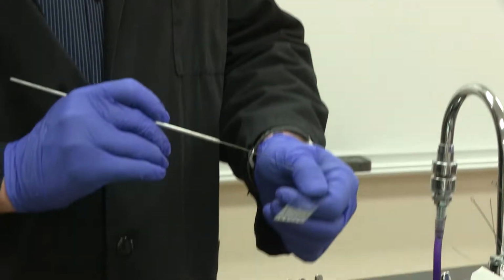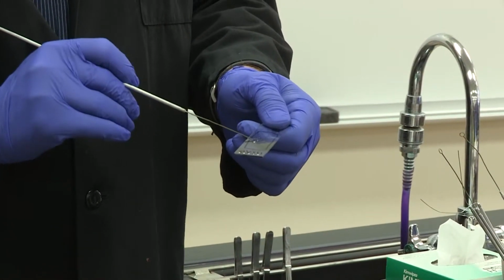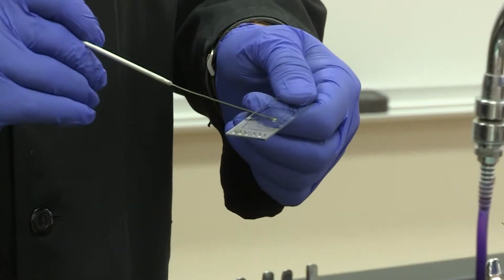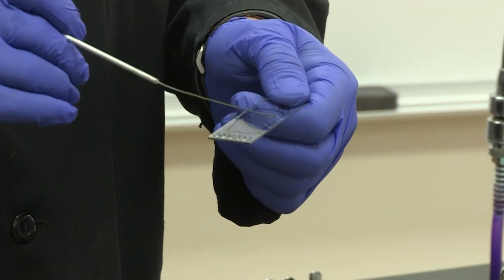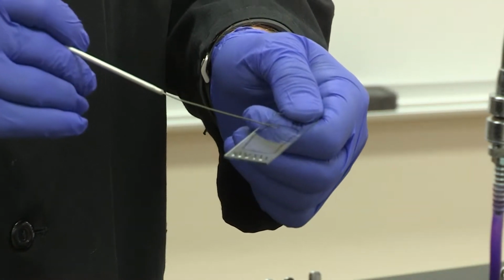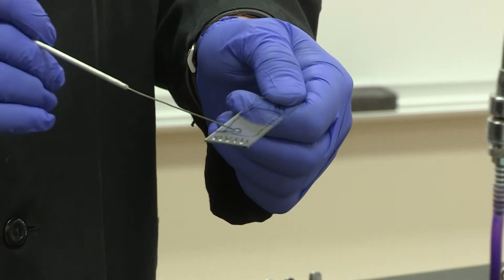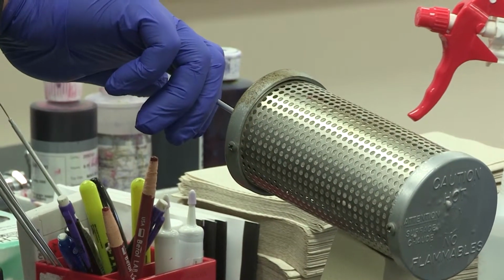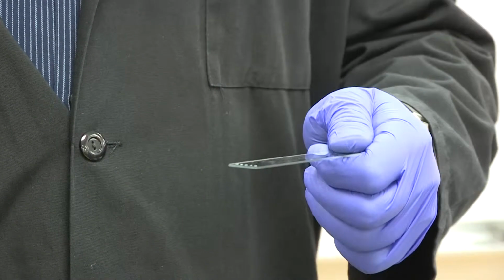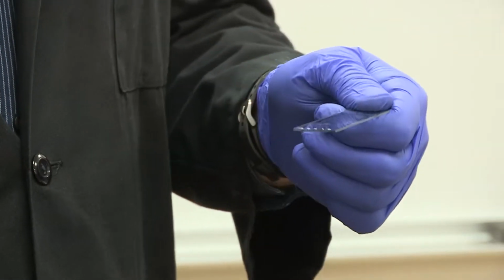And then you're going to take that and mix it with the water. And you want to spread out that water-bacterial mixture all over your slide so that you can fill up exactly the space that you marked out. Okay? So notice that this is now biohazardous, so you want to make sure that you incinerate that before you go on. Okay? Now, the next step, of course, is to let this air dry. You want to make sure everything is dry before you move on to the next step.